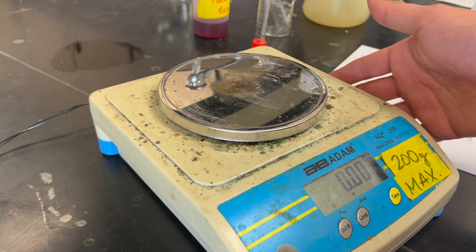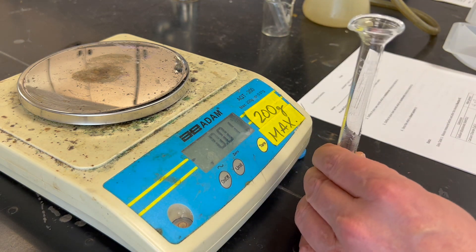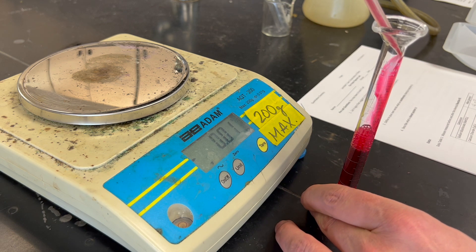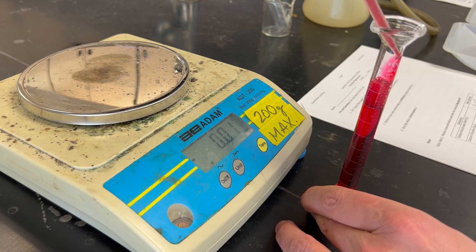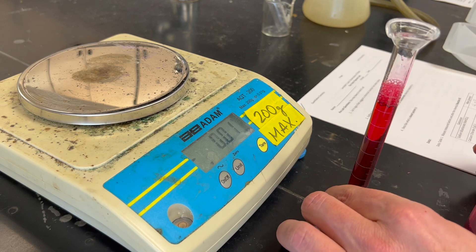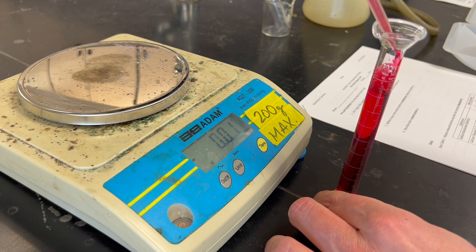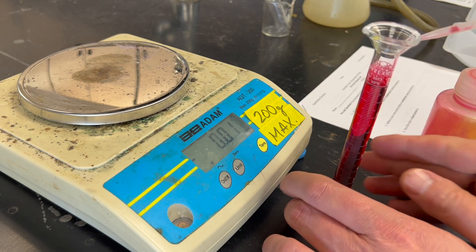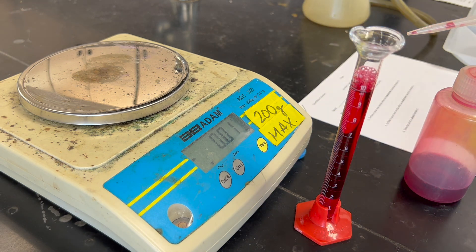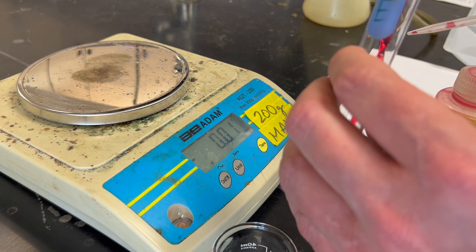The next step in the lab is to measure 10 milliliters of phenol red. We're going to carefully measure 10 milliliters of phenol red into a graduated cylinder and then pour the phenol red into a test tube.